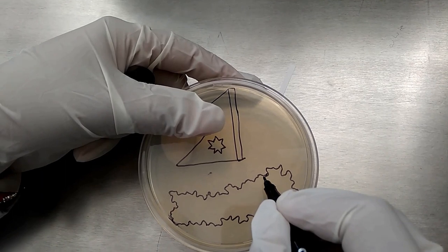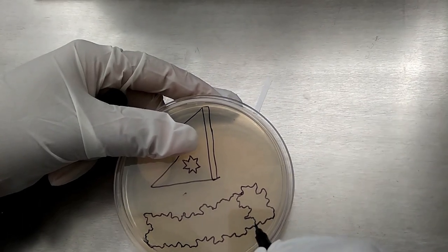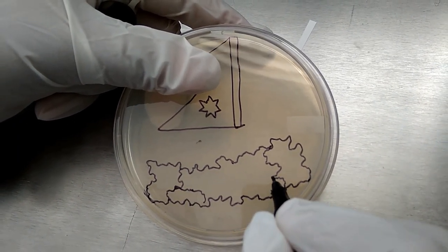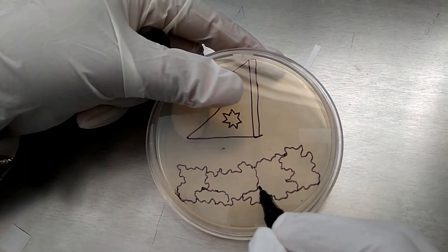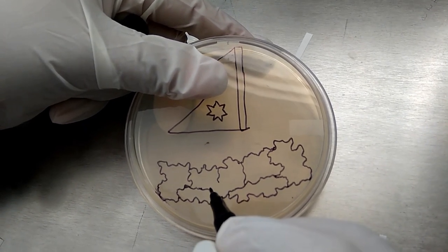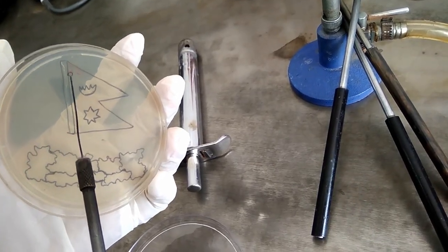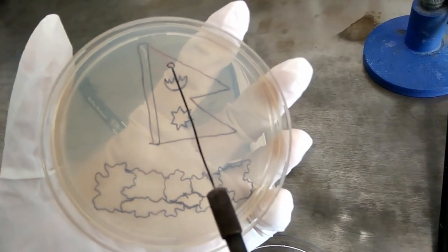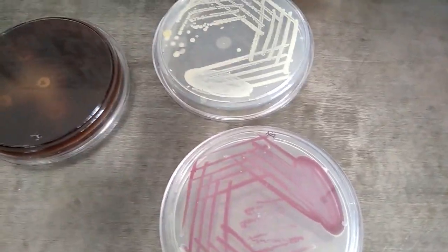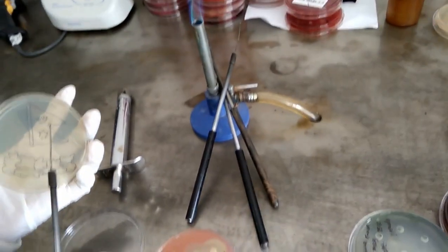Now imagine which type of art you are going to prepare — that is, the image that will facilitate your art for better expression with these available organisms. Take a nutrient agar or Mueller Hinton agar, but we took nutrient agar because all the microorganisms we have can easily grow on it.